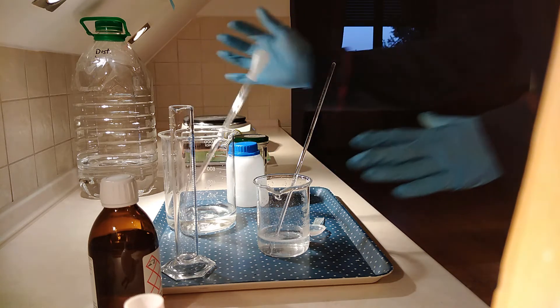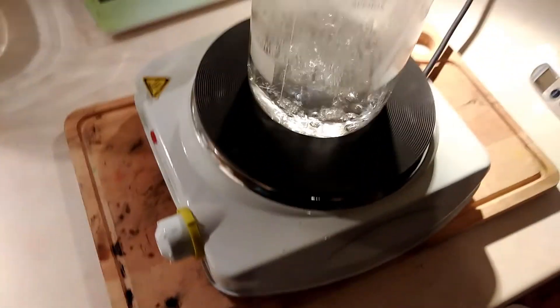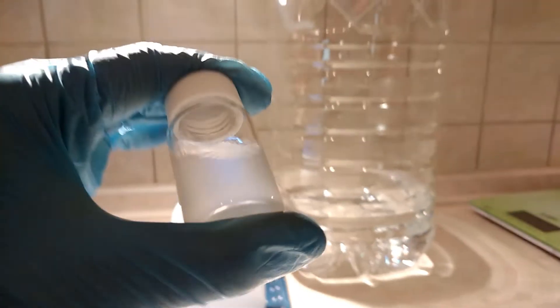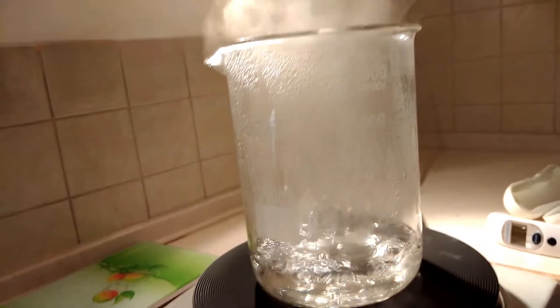So I'm gonna add the neutralization and get back to you later. To get higher contact with the hot plate, I switched from the small 250 milliliter beaker to a larger one-liter beaker, and now it's boiling. We gotta let it boil down to quite a small amount, then transfer it back to the smaller beaker and basically recrystallize it. I also checked an alternative method of precipitating it out using acetone, but it didn't work. So I have to stick with the classic method of boiling it down.